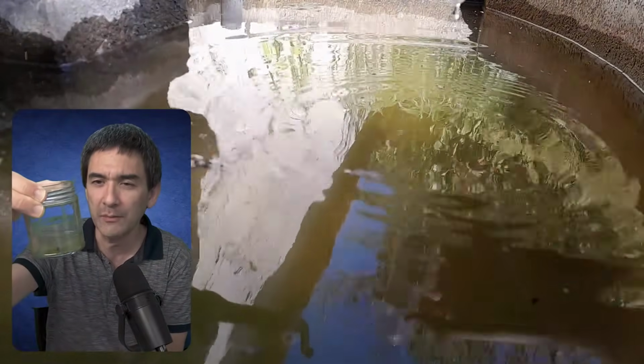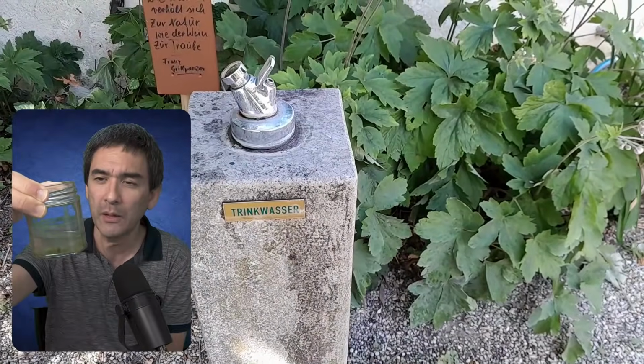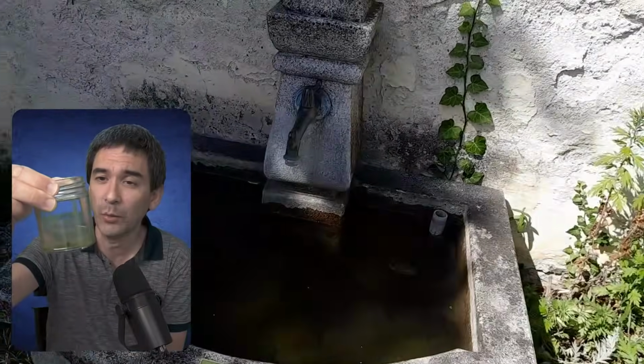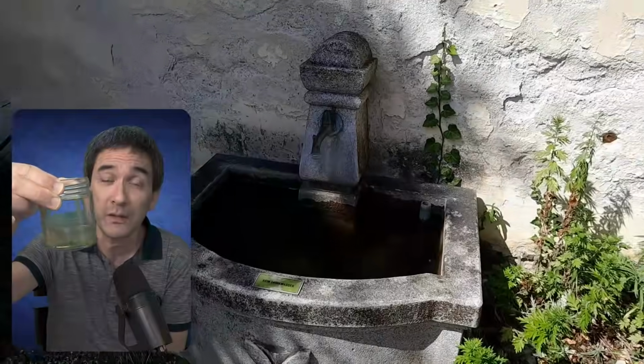What I also sometimes recommend, and have tried, is to add a very small amount of fertilizer. Mineral nutrients, in other words. So you take a water sample like this and add a tiny drop of artificial fertilizer, like you use for fertilizing flowers. This will provide the nitrogen and the phosphorus for the algae growth.